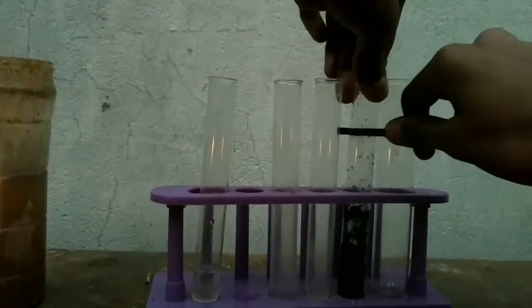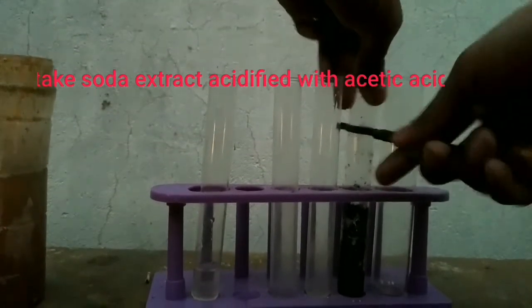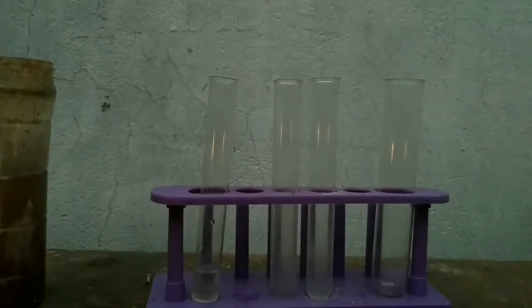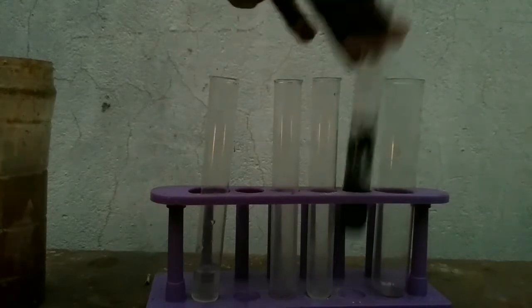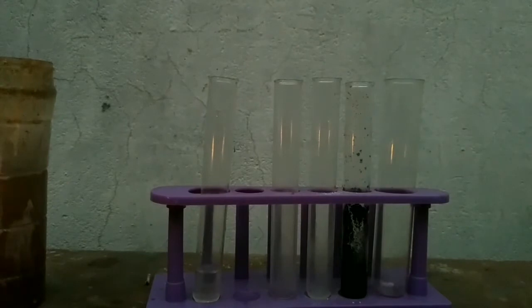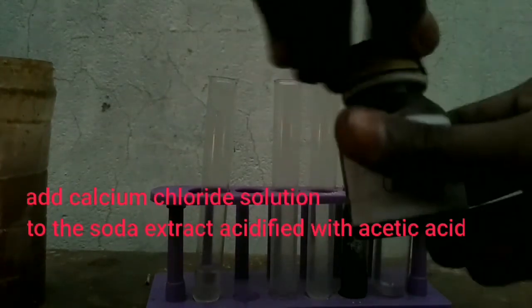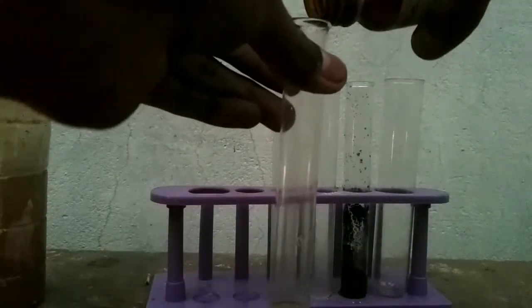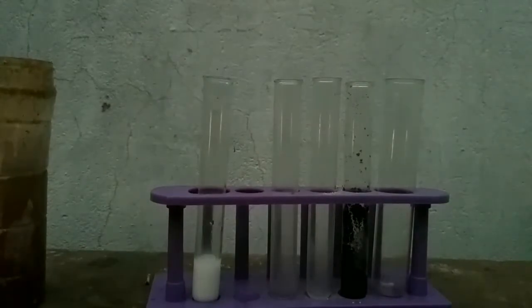Now we will move to the second confirmatory test. Take the soda extract acidified with dilute acetic acid. Now we will add calcium chloride solution into the solution. A white precipitate will be formed.